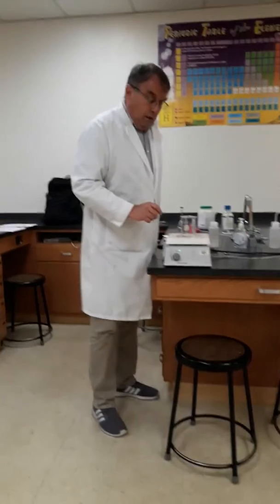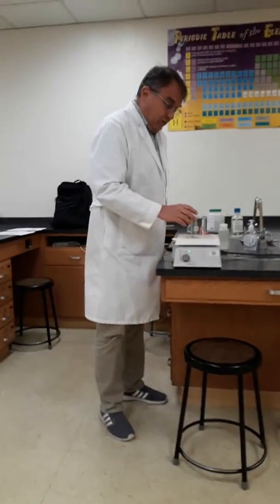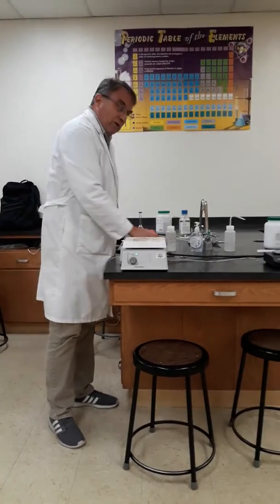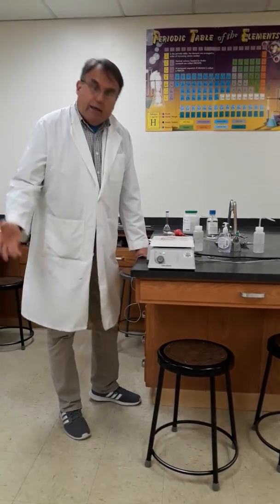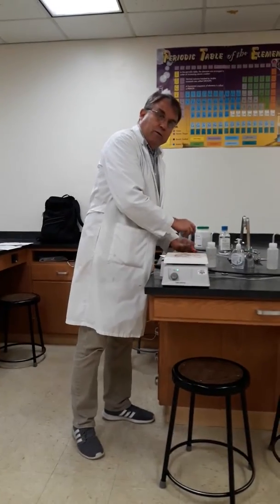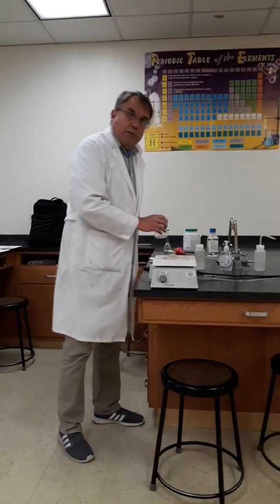Woo! Okay, so it is fully dry now. So what we need to do is take it off the hot plate and allow it to cool. Again, another boring wait time. So through the magic of pausing, pause, and it is cool. So now it is cool.